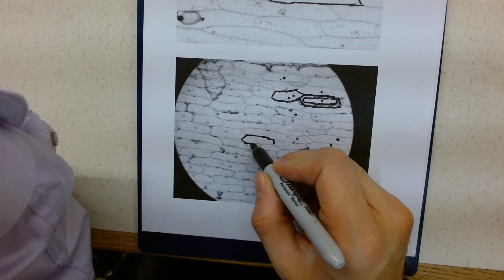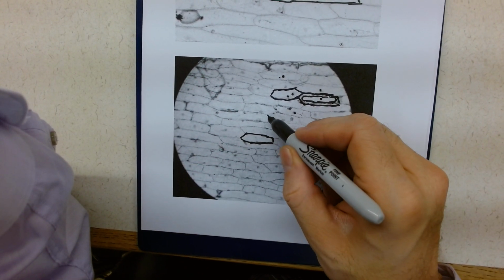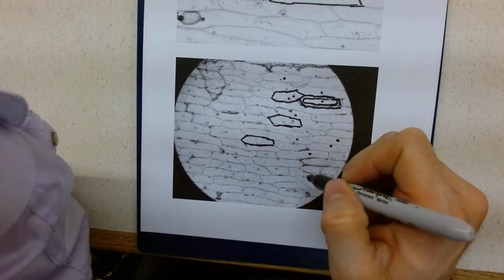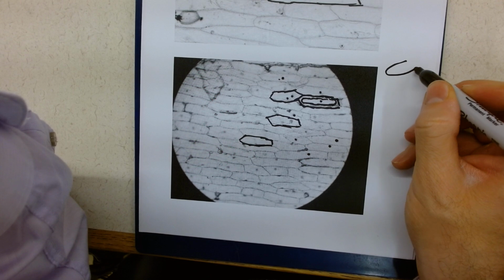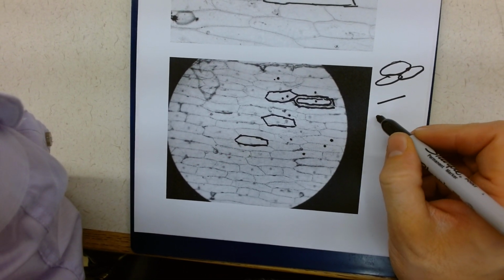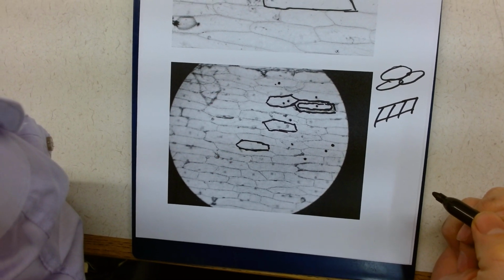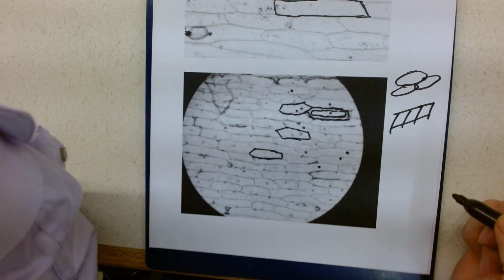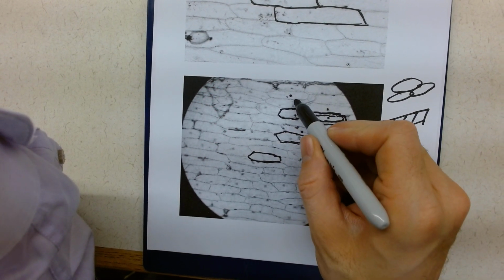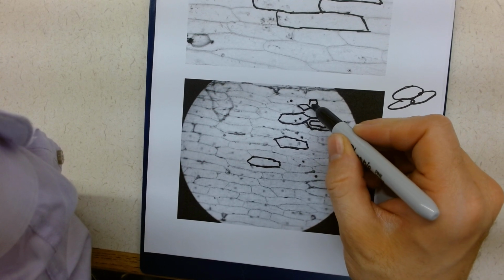So your lab should be showing, when you draw, you should be attempting to accurately capture individual shapes. See how each individual shape is different. I do not want to see something like that, or that. That is not an accurate representation. That is a symbol and not something that I want to see. We want to see individual, unique shapes that attempt to capture the reality that you see in front of you.